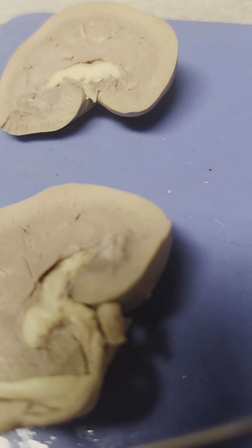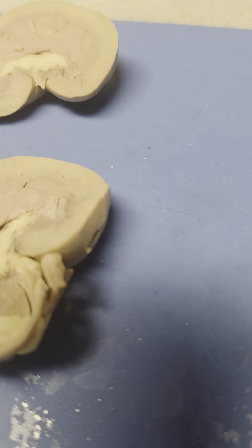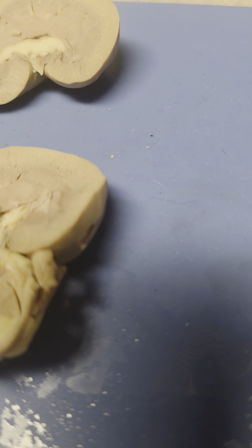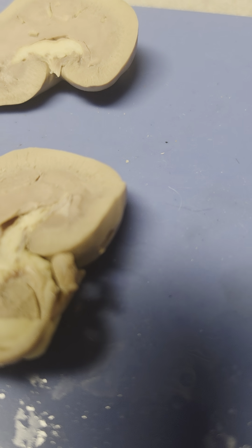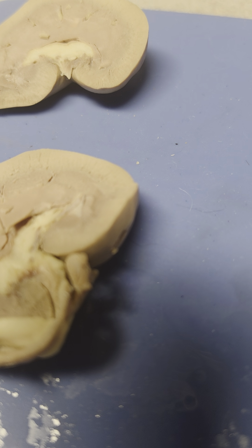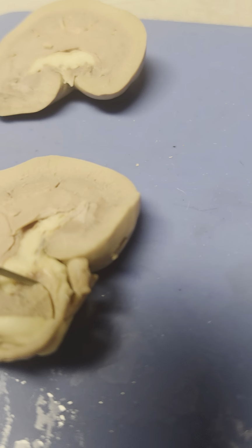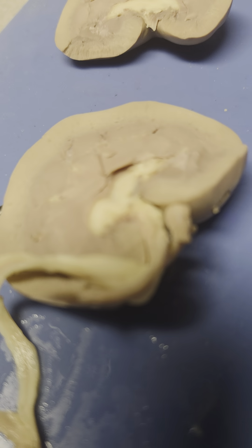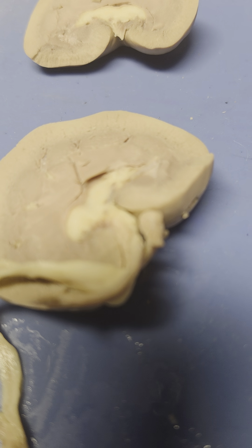The renal lobe, that's on the inside, that's internal, and that consists of a pyramid portion of the cortex at the pyramid base, so down here, and a portion of the adjacent renal column. Then we also have the renal corpuscle, that's also internal, and that is a glomerulus enclosed within a glomerular capsule, and that's the site of the filtration. The renal capsule is a tough layer of connective tissue that protects the kidney from injury and infection while maintaining its shape.